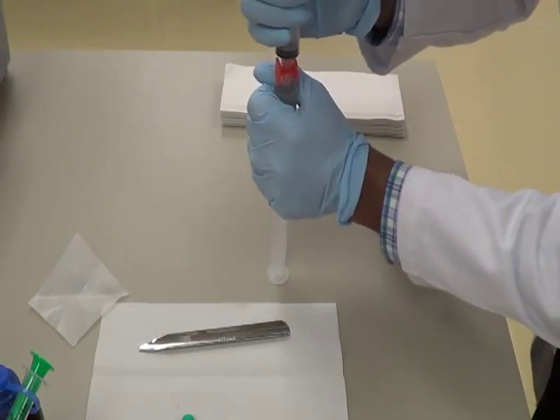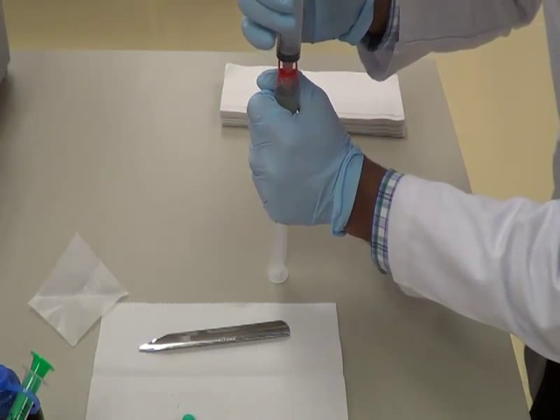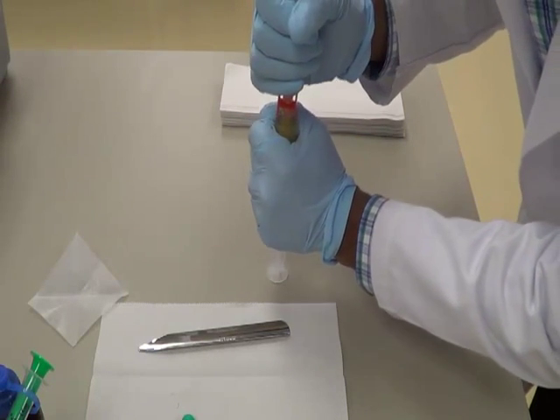And again the same thing. Flip it upside down. Now hold the bottom syringe tightly and the top syringe gently and push it down.